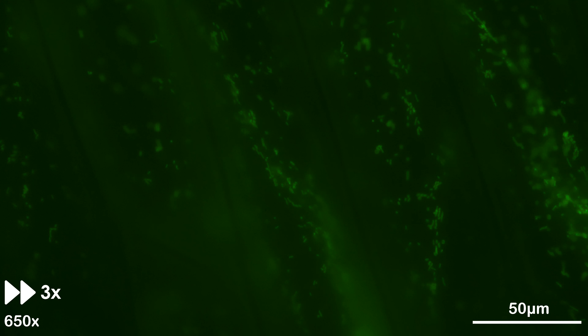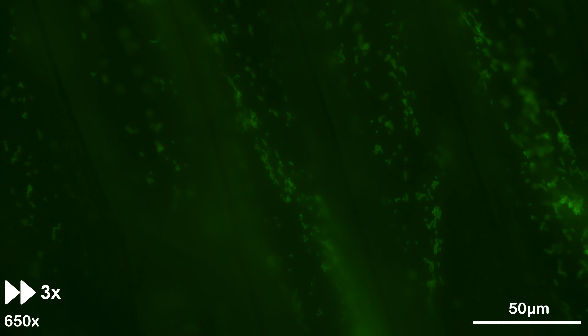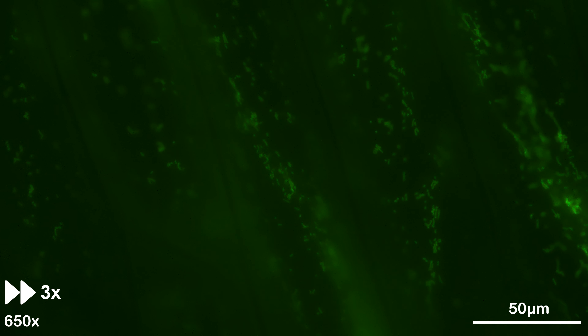To stain the onion cells, we add the dye to the epidermal onion tissue, incubate the cells for 20 minutes, and remove excess dye by washing the tissue. We then excite the fluorescent dye with blue excitation light and only allow light with longer wavelengths to pass. A detailed staining protocol can be found in the video description.